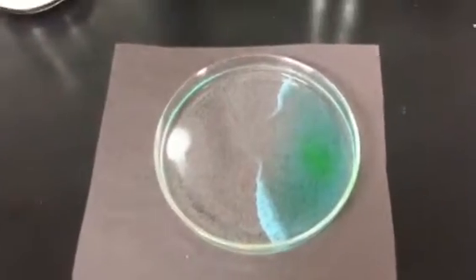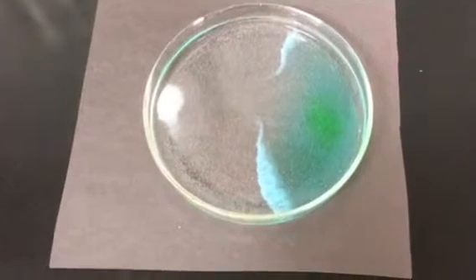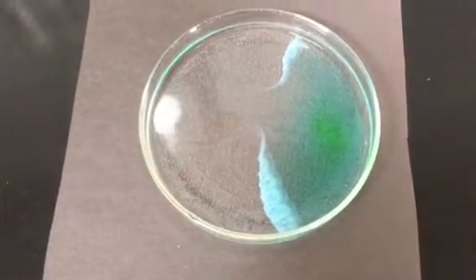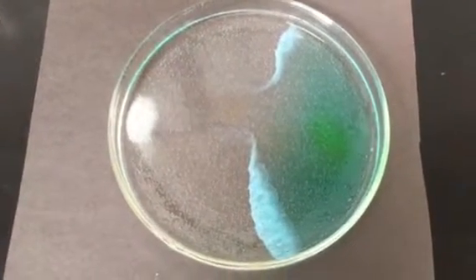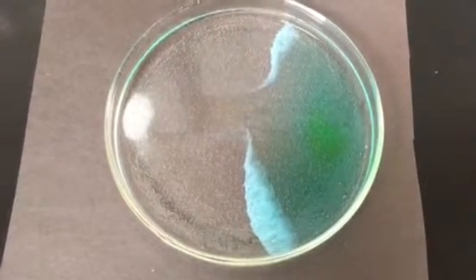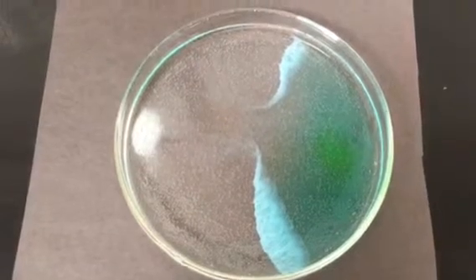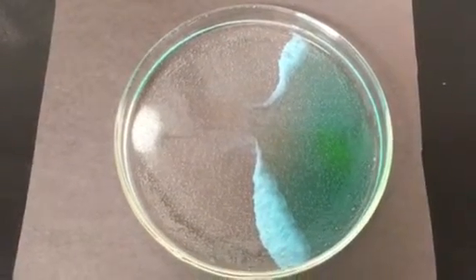If you think about what you're seeing here, you're starting to see something kind of like a powder forming at the edge where the two compounds are meeting. They've dissolved, and now they're starting to form this edge that looks cloudy. That's what you're seeing in the video, and that's what we're also seeing live. It really does look cloudy.